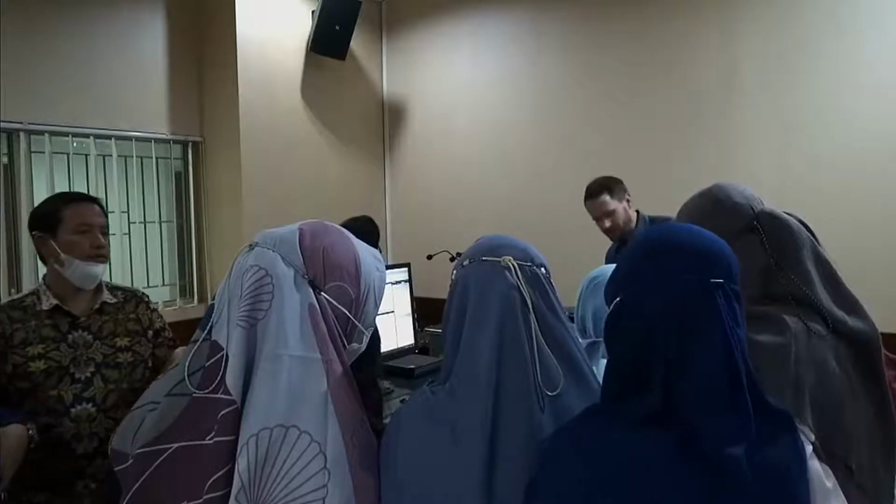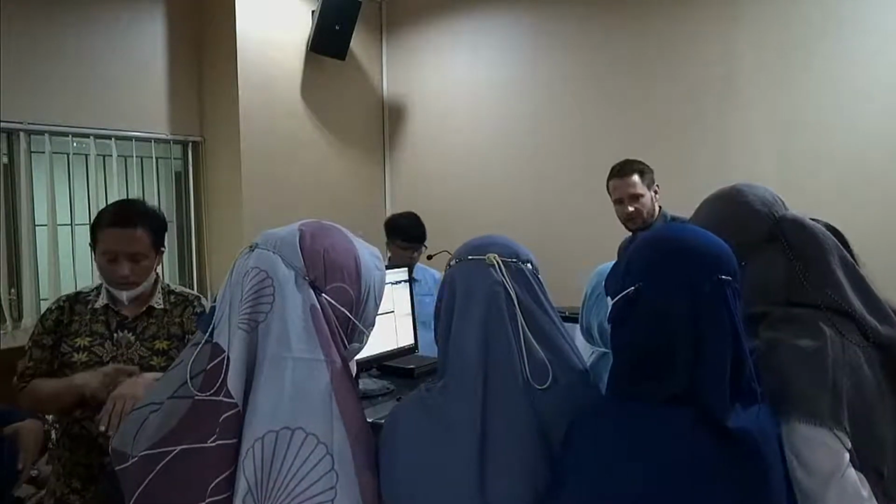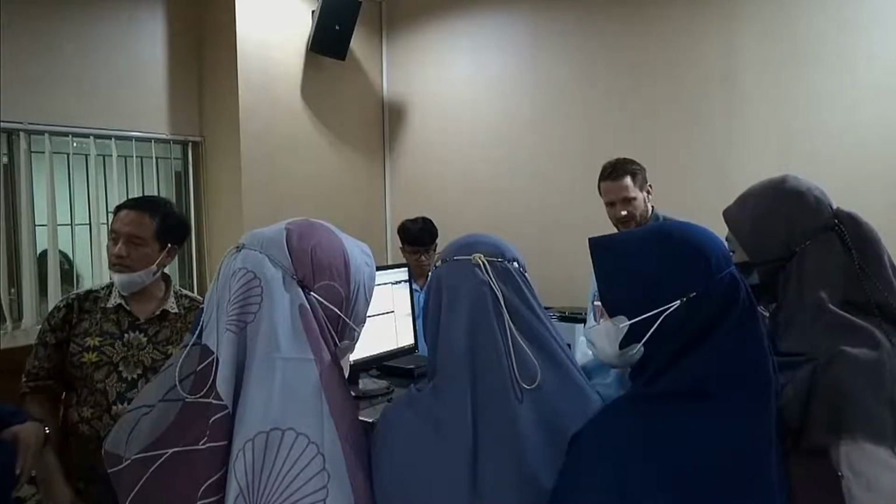I actually know this sample, that's why I brought it, but this would be the procedure we are doing now, a standard procedure for every unknown sample. So if you give me your sample, I will do the exact same thing. I will never add it directly there without knowing what it is, without knowing how it behaves, without any experience in measuring it. Never, and I show you why.